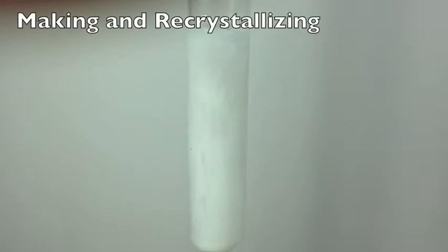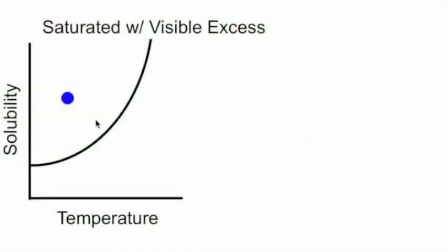So here's a test tube with some obvious excess crystals there. And you see the blue point is above the curve, so that means we have visible excess.